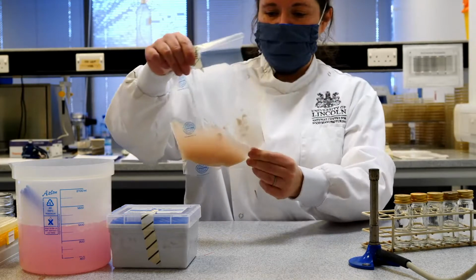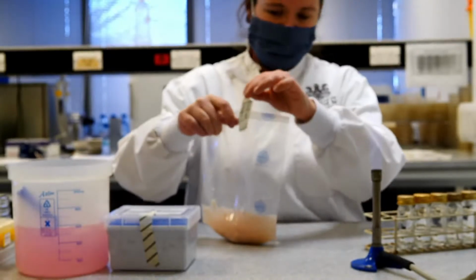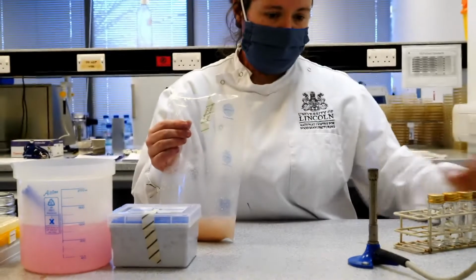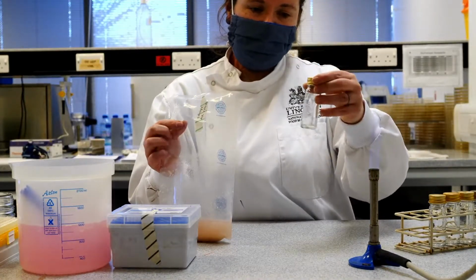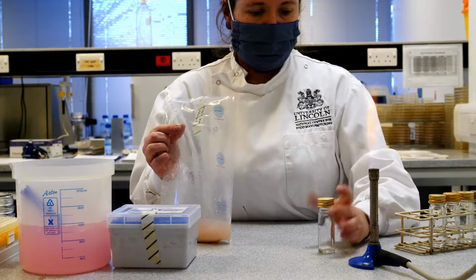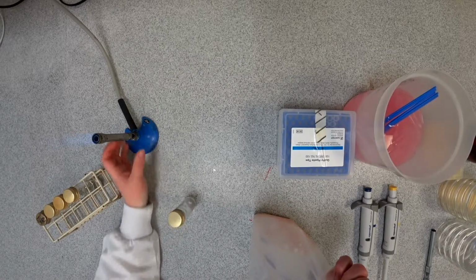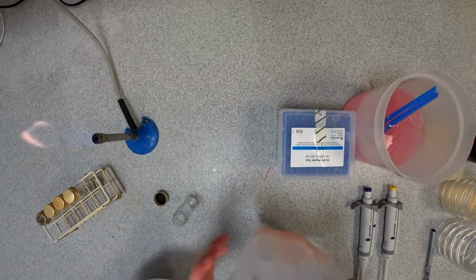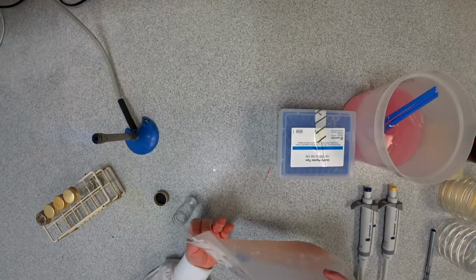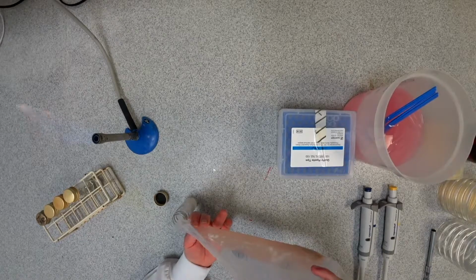The first thing I need to do is try and get my sample out of this bag, because this is big and messy and dirty, and what I don't want to do is end up getting bits of sausage meat all over our lab equipment. So I've taken an empty, sterile glass bottle, the one that I've labelled as 10 to the minus 1. I'm just going to sterilise the neck of the bottle and then transfer just a little bit of this liquid into this bottle. It'll be a lot easier to use then for all of the subsequent steps that I need to do.